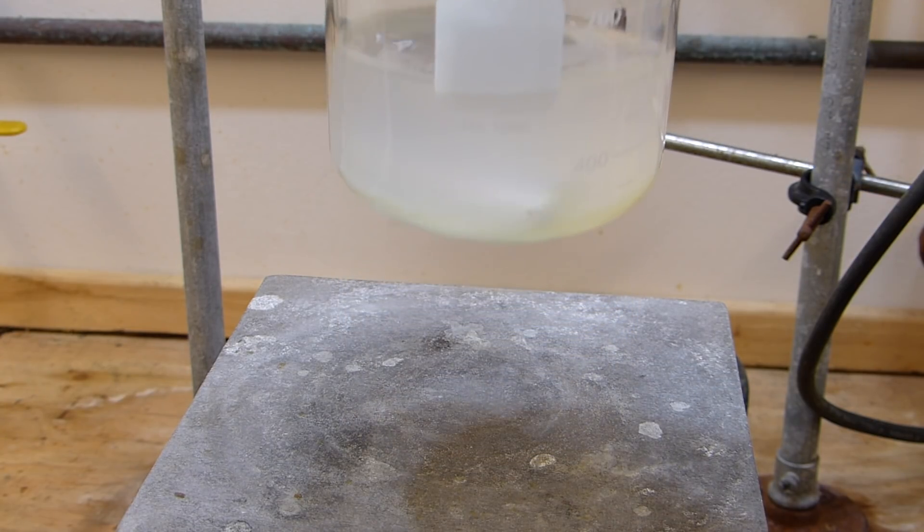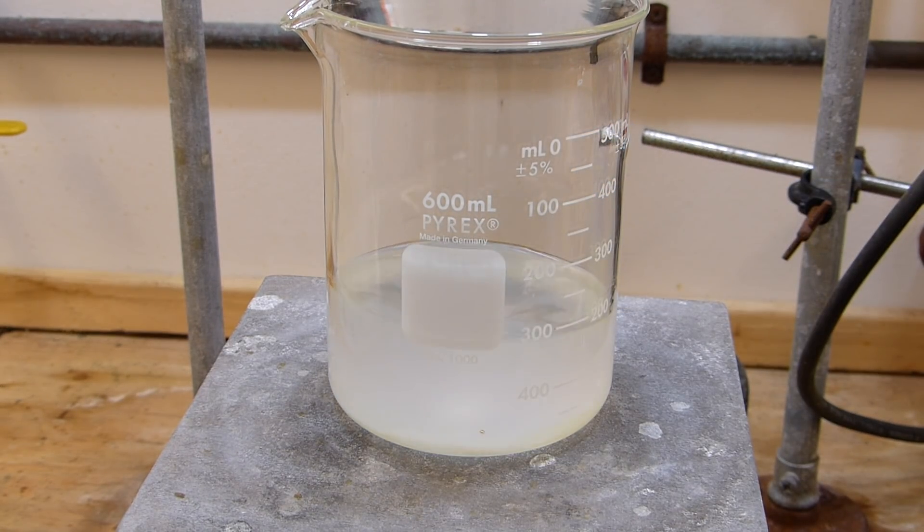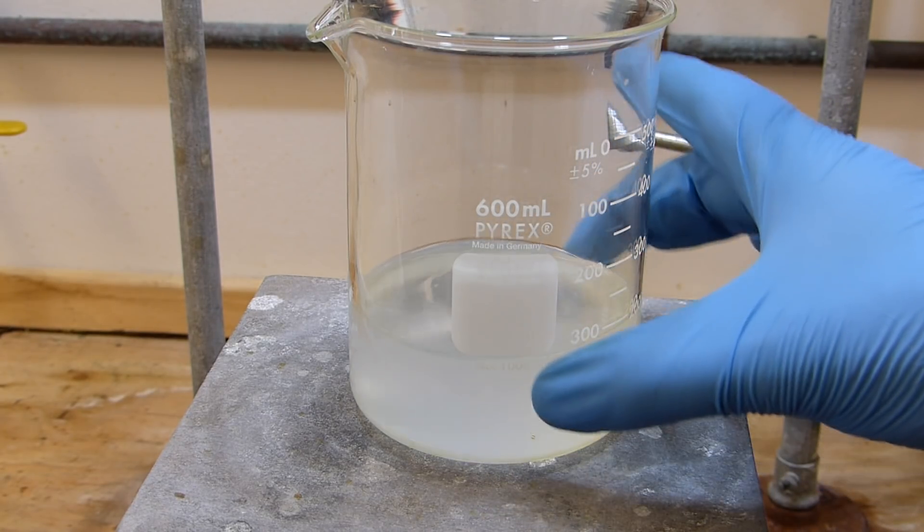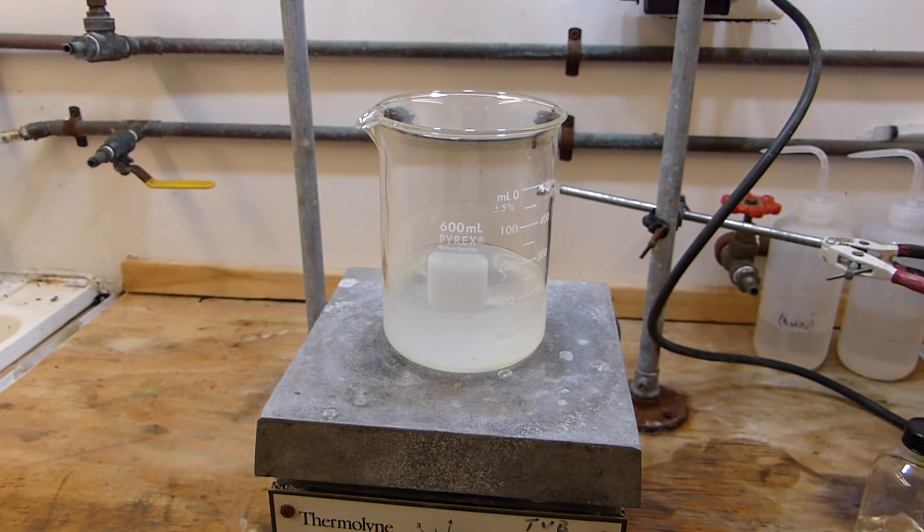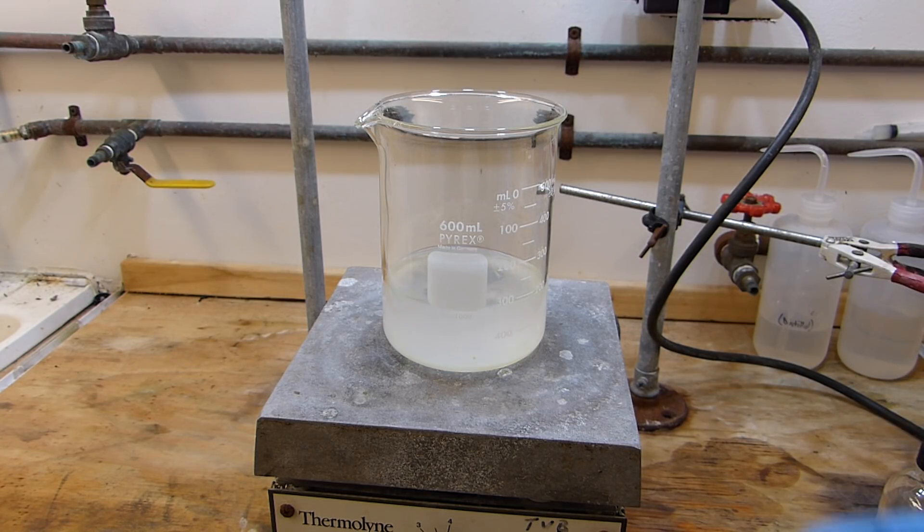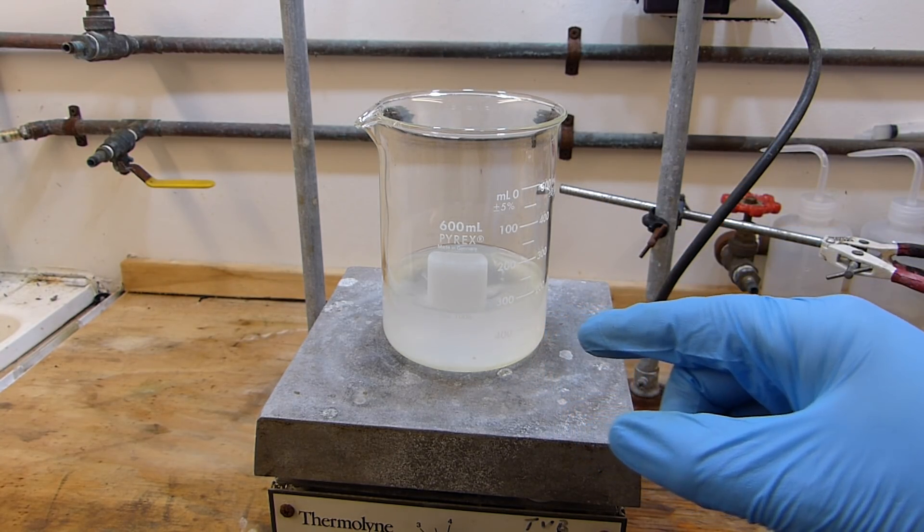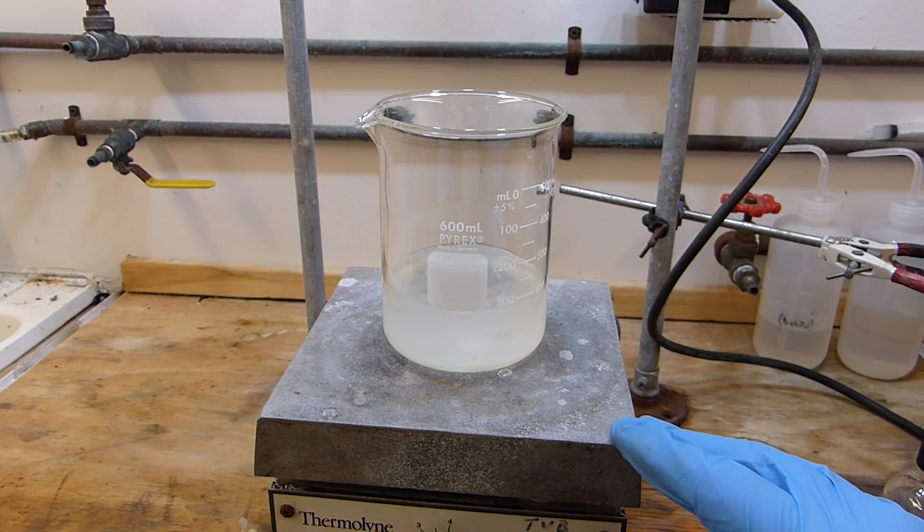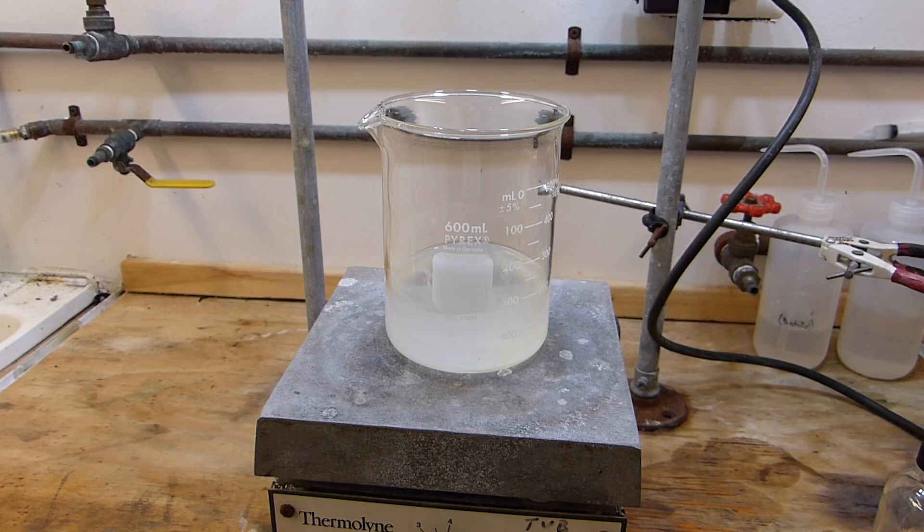We don't want this to boil or anything, we're just trying to get it to destroy the thiophenes and react with them to form the sulfonic acids. You can see after stirring for a few minutes that the sulfuric acid layer has gone sort of a dingy yellow color and that is because of the absorption of sulfur compounds, particularly the methylthiophene sulfonic acid. That's also why the sulfuric acid is clouding this layer of toluene, because of the suspended sulfonic acids as well as micro droplets of sulfuric acid. As a comparison, the sulfuric acid started as a completely transparent water-clear liquid, completely colorless.